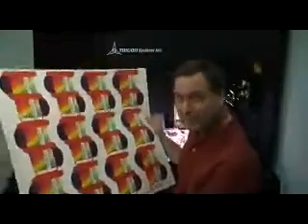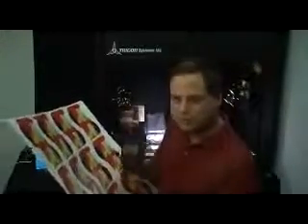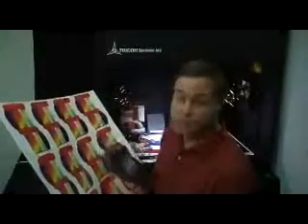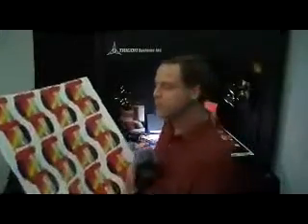What would the print industry currently use to measure something like this? Well, they have a device called a spot spectrophotometer, or spot spectro. There are hundreds of different kinds on the market, capable of measuring color at a very specific point, or a spot. The spot may be somewhere in the order of a 32nd of an inch in diameter. Okay, so we're talking very small spots here.